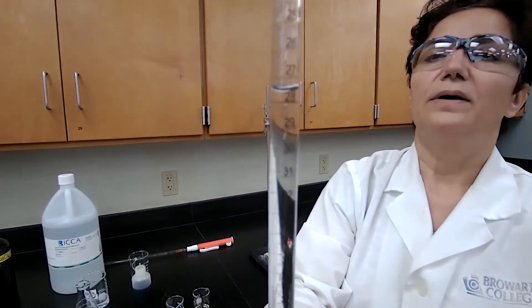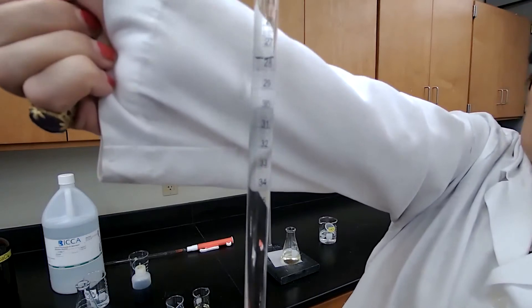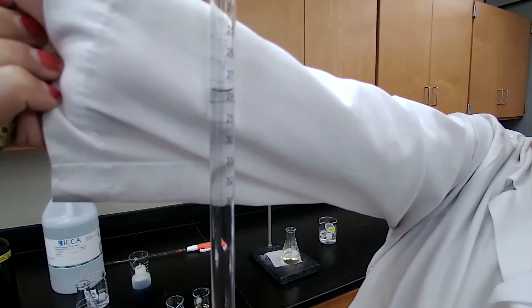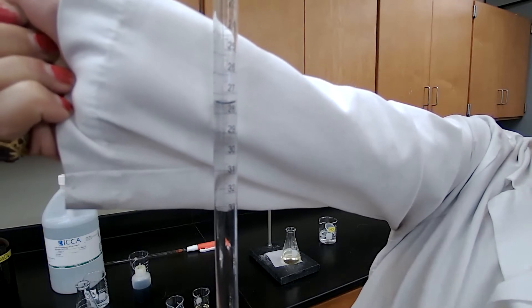So that is the value, the number for final burette reading. Record your number for final burette reading.